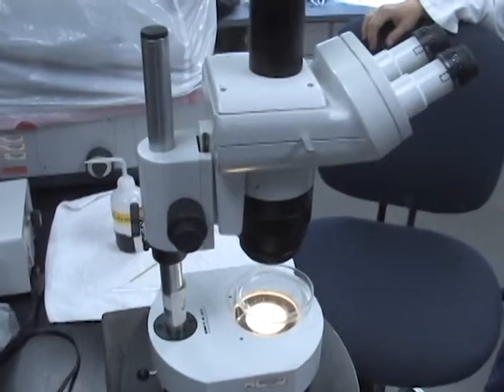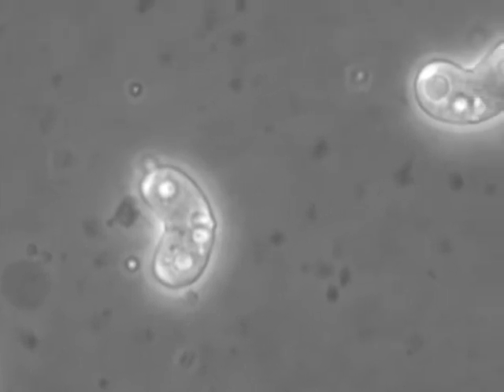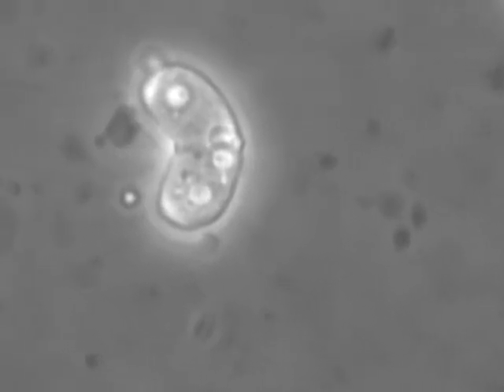If we take an anal swab from those fish and look at that sample under the light microscope, we may see spores here, such as these characteristic kidney bean-shaped spores that are typical of C. shasta. We may see those under the microscope, and these spores are only about 10 microns long. And if these aren't visible under a microscope, then we do a molecular test, PCR, polymerase chain reaction, that is specific for C. shasta.